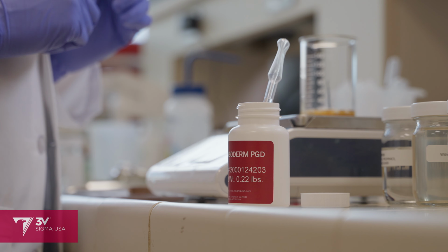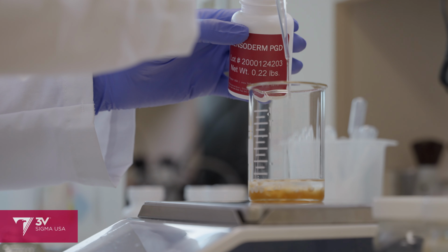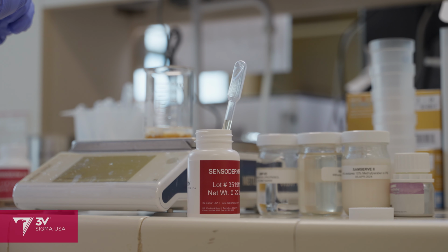And I think this is a really cool concept because it enables the formulator to lock in their emulsifier, rheological additive, their preservative and chelating agent, and by just changing the emollients or even just the emollient ratio, they can create this diverse portfolio of emulsion products.